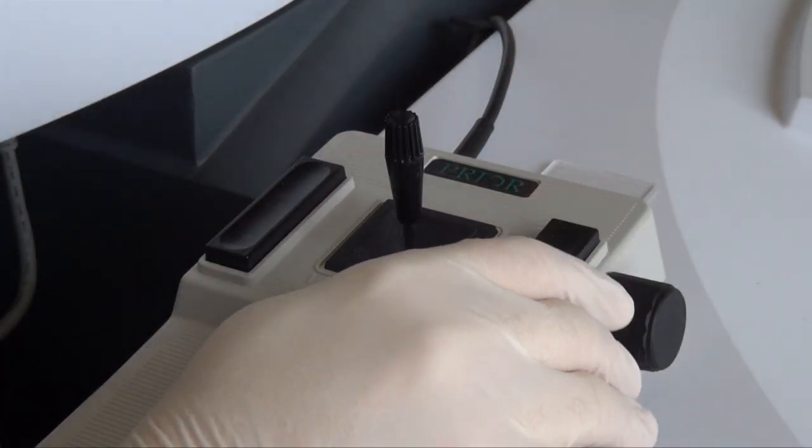A germanium crystal is then placed in front of the microscope lens, and the sample pressed gently against it.